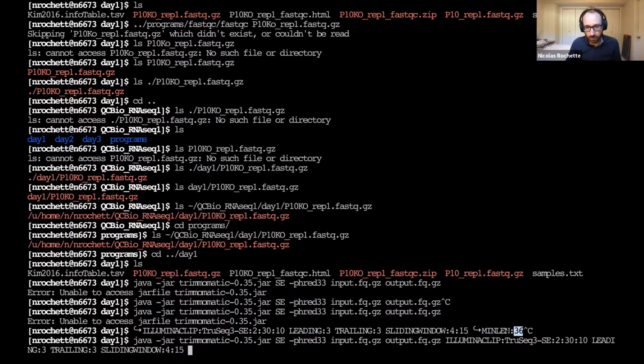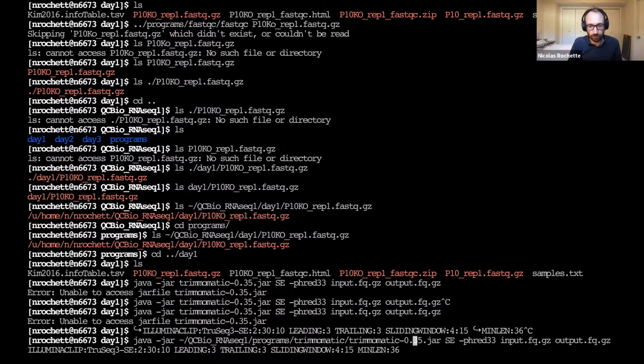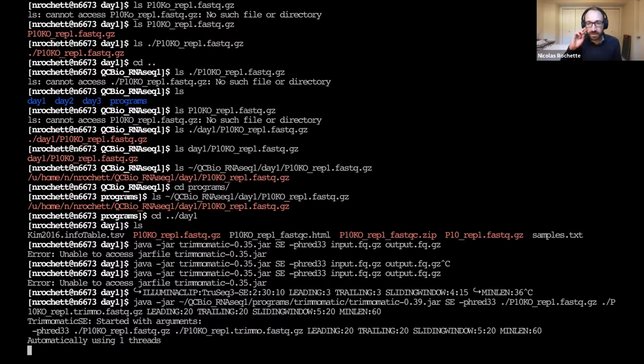Yeah. So in this case, I'm just having these very fancy symbols here. Then, just very quickly changing the line. Okay, so let's say this is our first command, and it's going to take some time to just run.